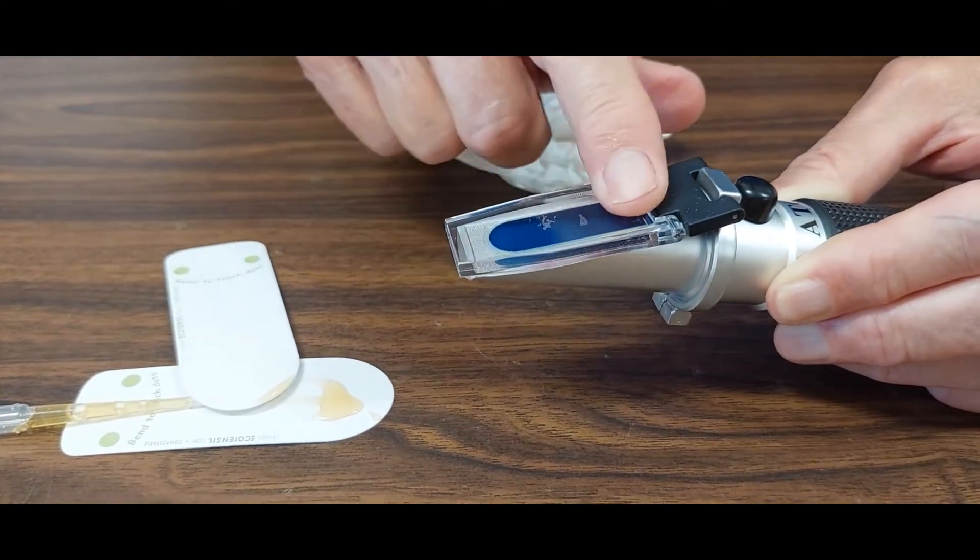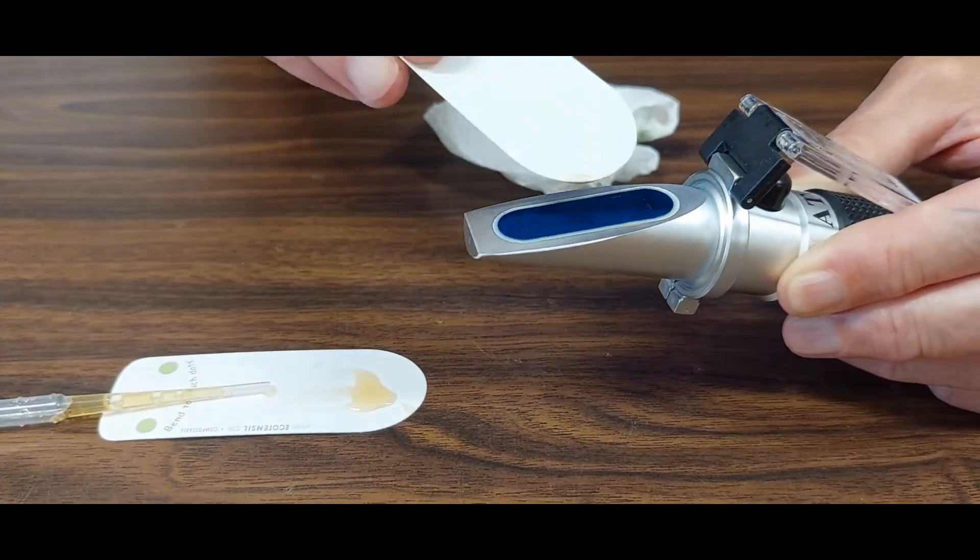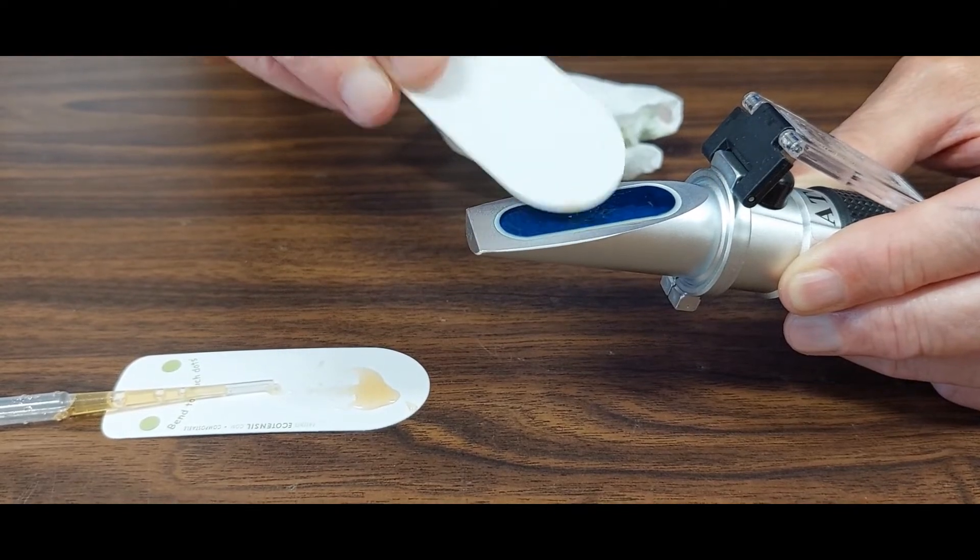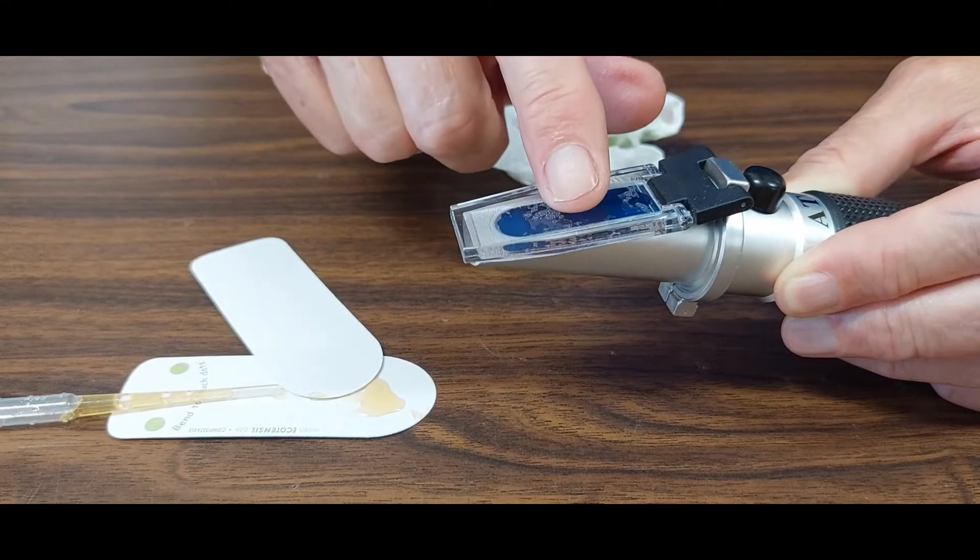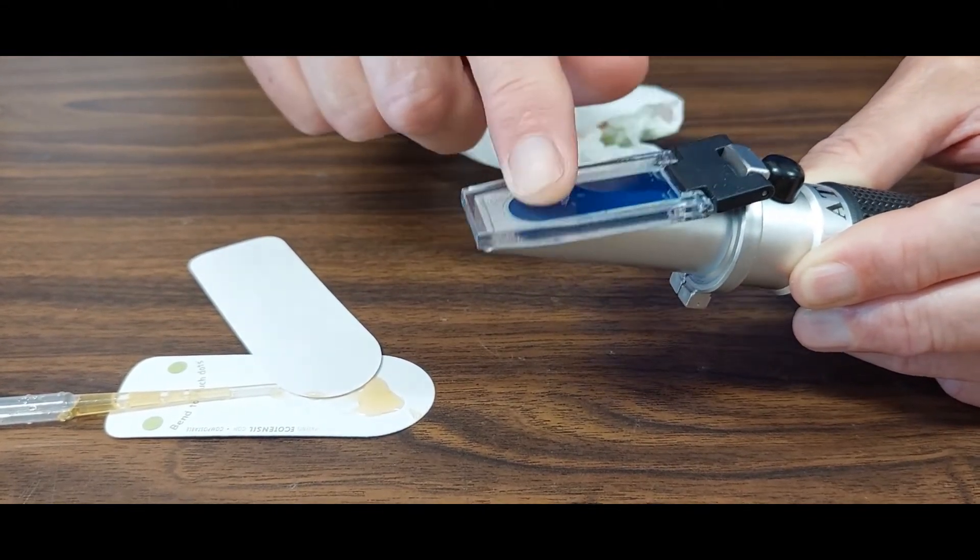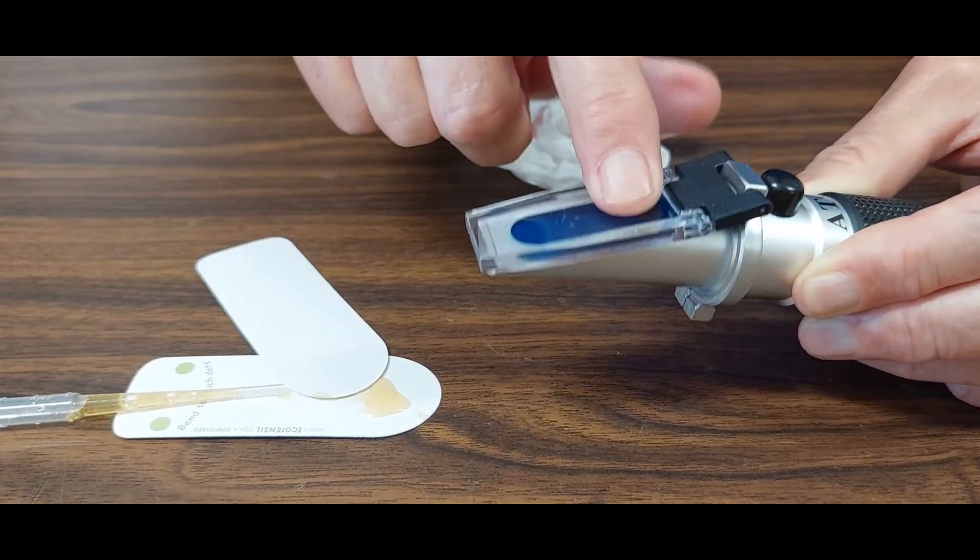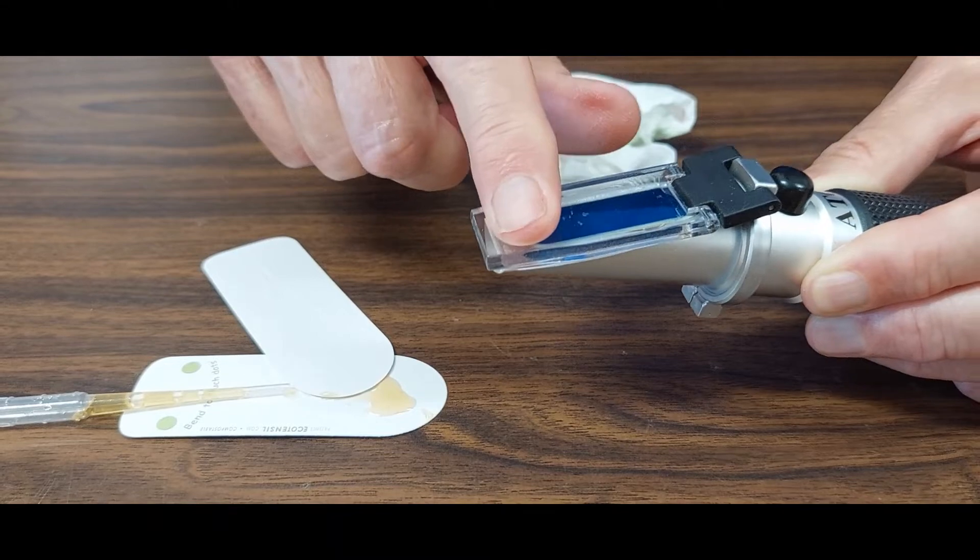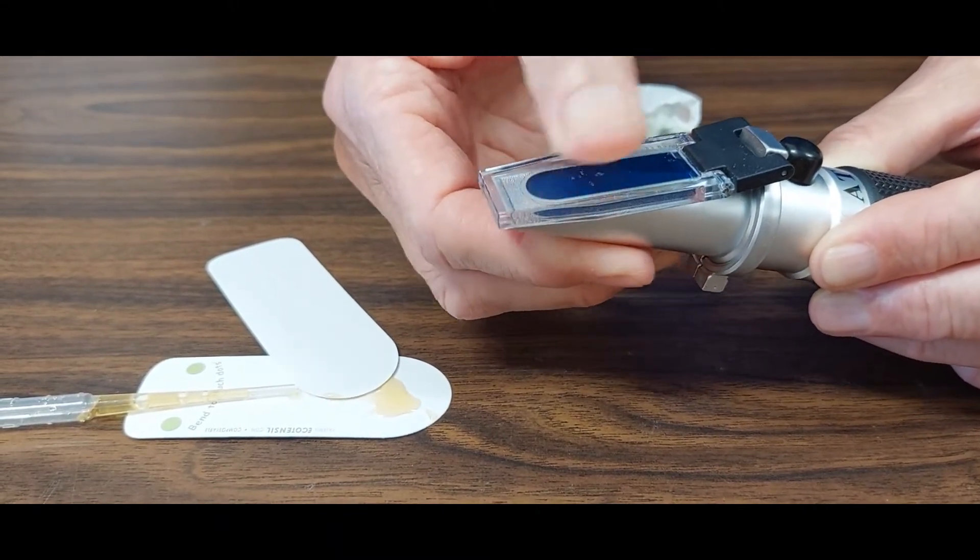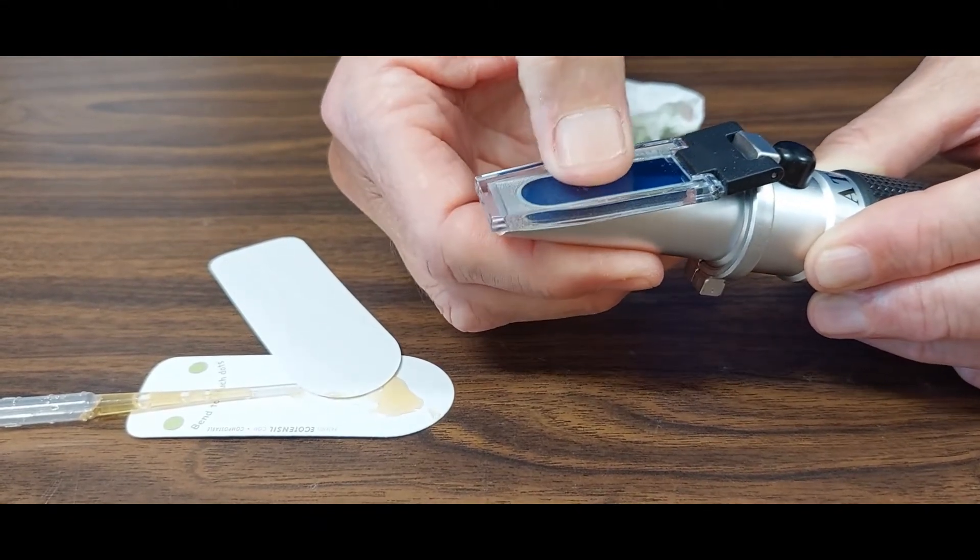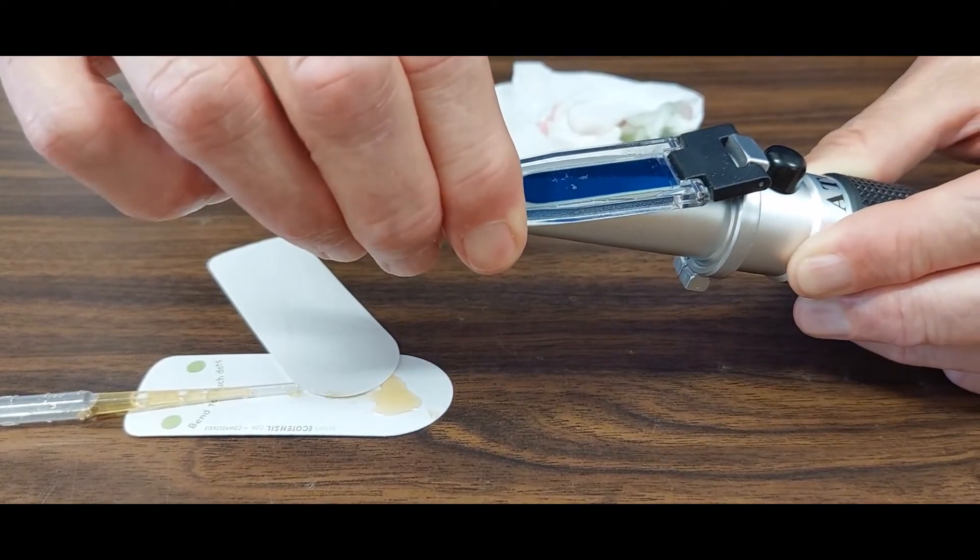Looks like that's not working, so I'm going to lift it back up again. I possibly need a little more in that center. It is important to get those bubbles out. I'm just pressing, making a really thin film.